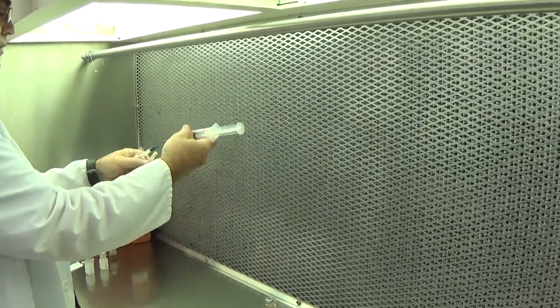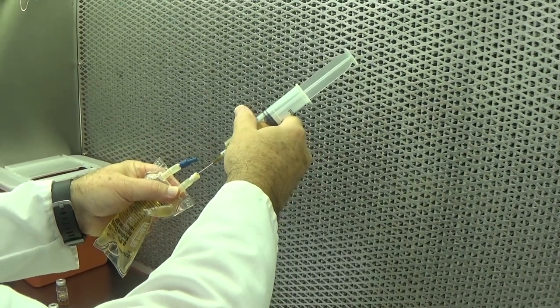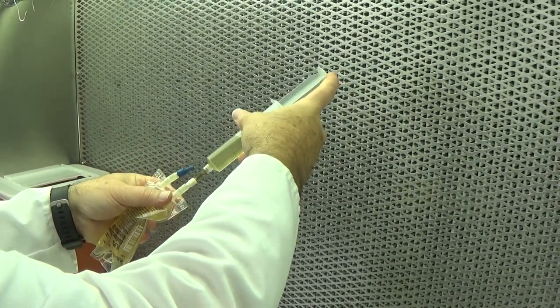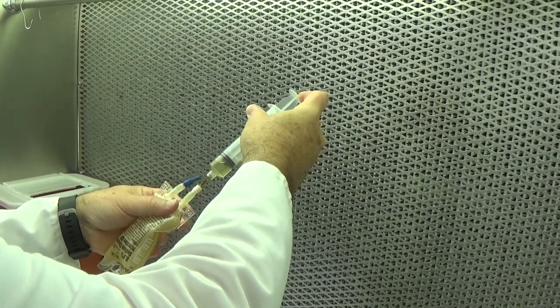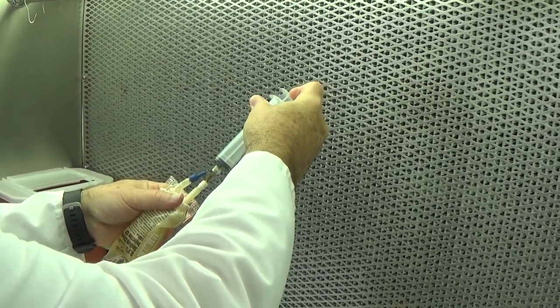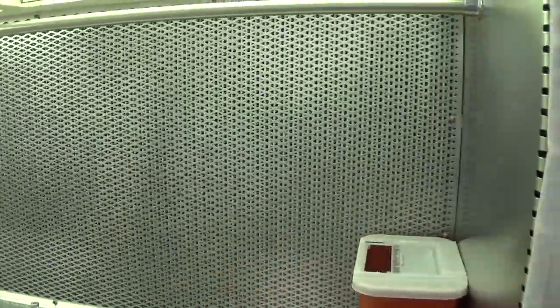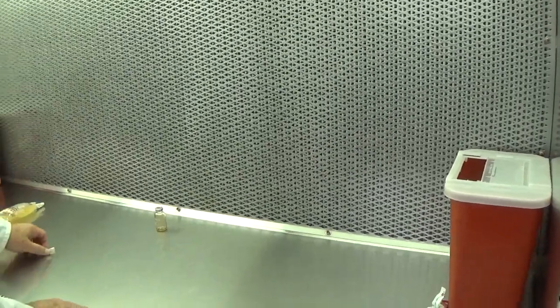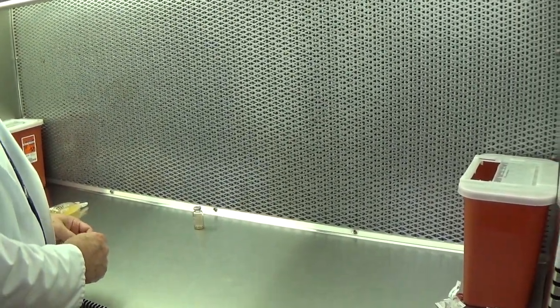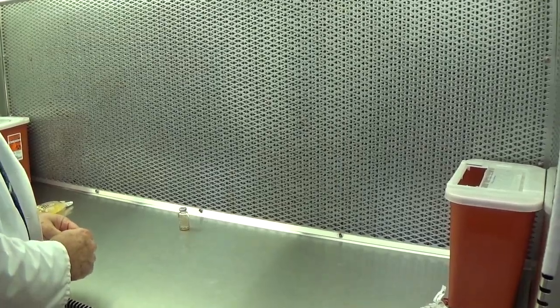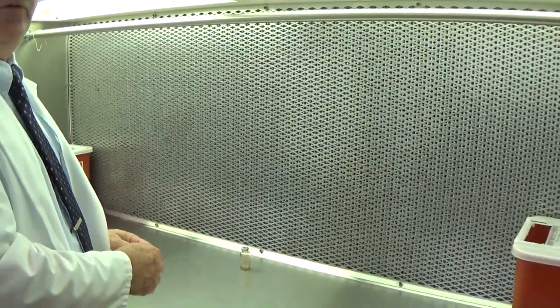And again, with our reconstituted powder for an IV admixture, I would then introduce it into an IV bag and dispose of my needle and syringe. This would conclude most of the manipulative techniques that are typically used in day-to-day operations of a laminar flow hood.